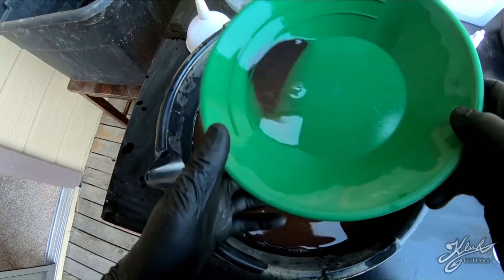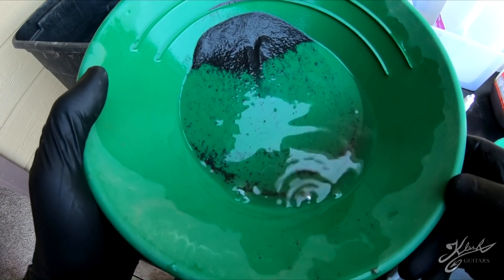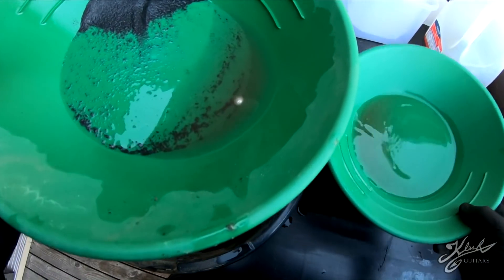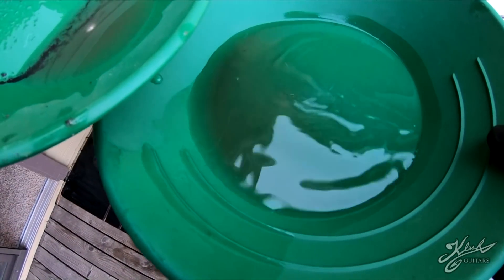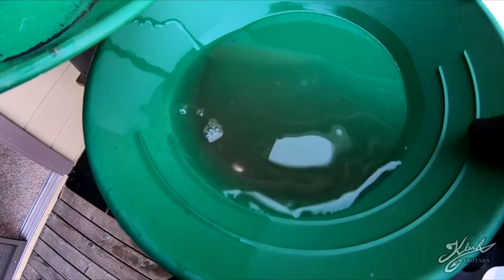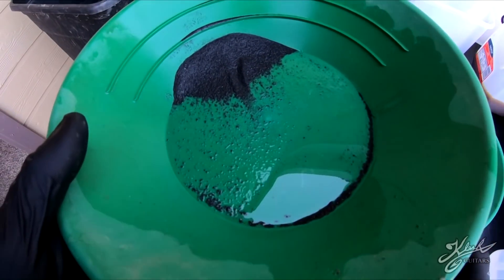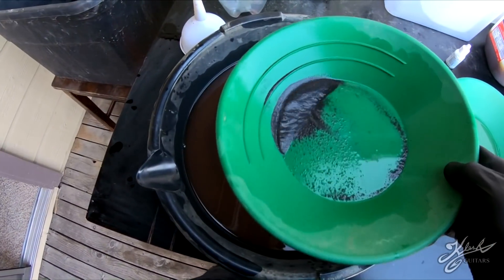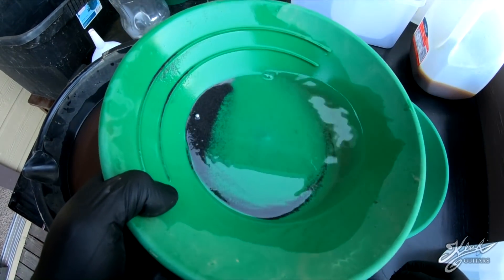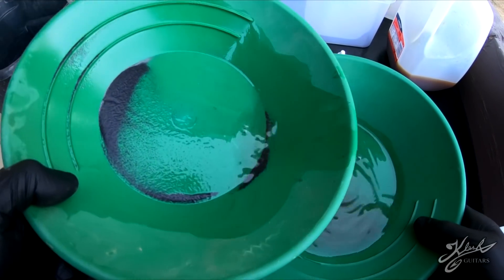At that point we could stop panning and bring it back - and there you can see the blob of mercury comes right out. We're going to move that over to this other pan. Notice I have some water in this pan - you always want to keep mercury underwater when moving it around. There's still a little bit of mercury left in here, let's pan that down and get it out. Here's the other ball of mercury - let's bring that down and pour it off.